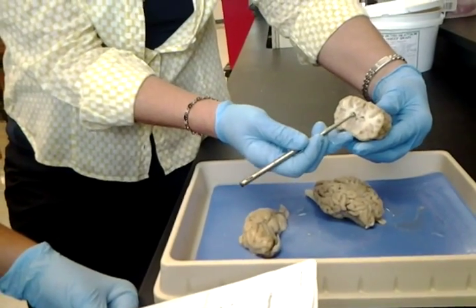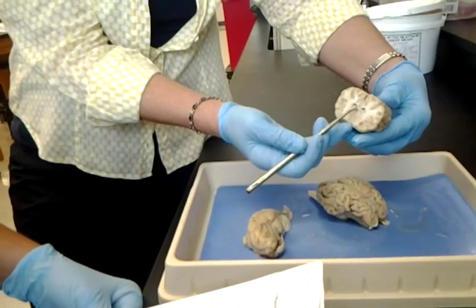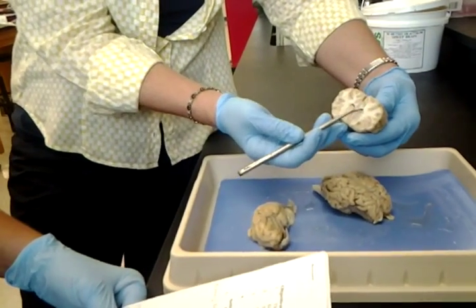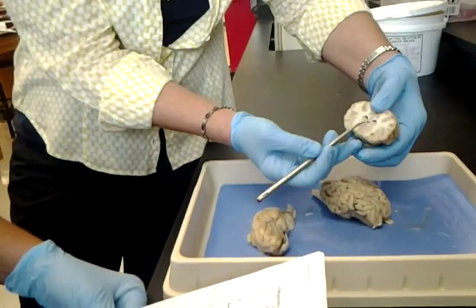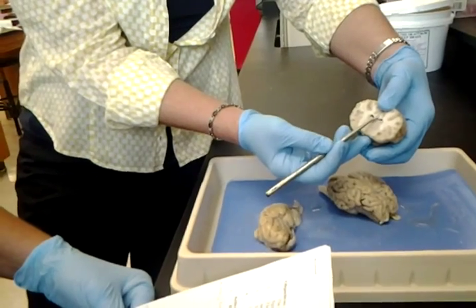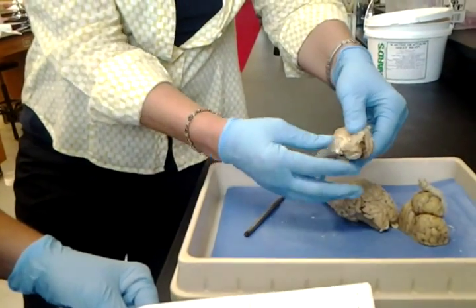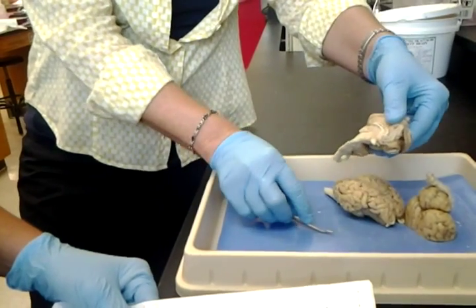These are the lateral ventricles, one, two. The fornix is here. There's the third ventricle. Best way to see the third ventricle, I think, is this view. The lateral ventricles, third ventricle, the white matter in between, fornix. This curved one isn't very big here. That's corpus callosum, same as this on the top. We just cut it that way.